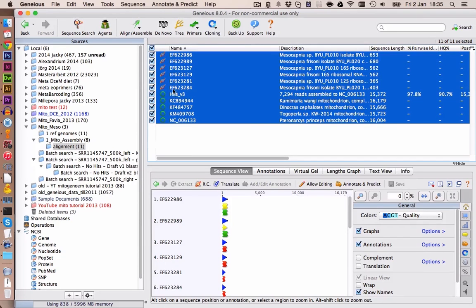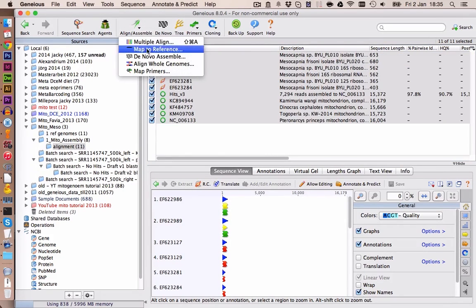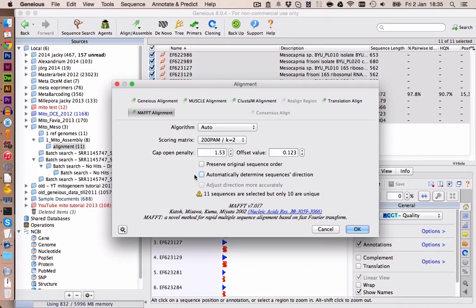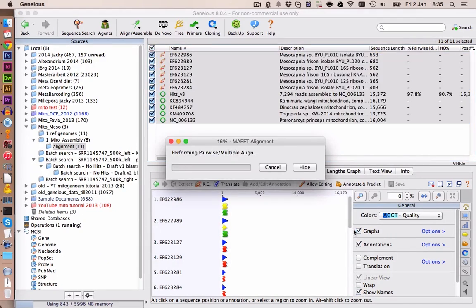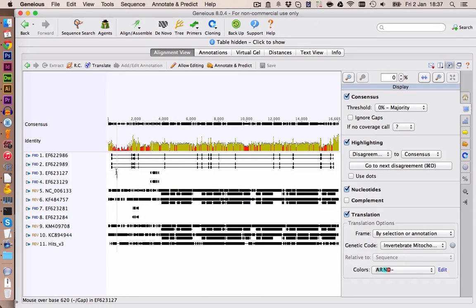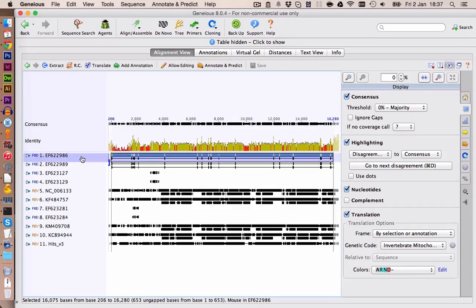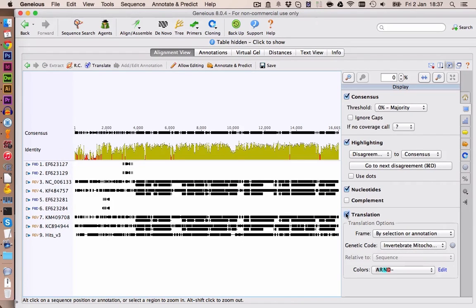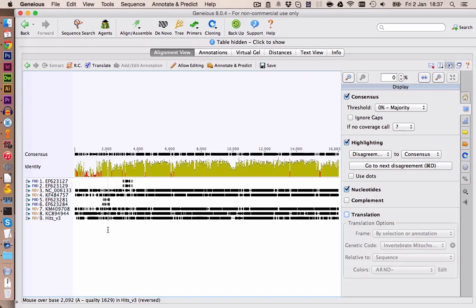Let's select all reads. And we're going to go on multiple align. We can try to let it detect the sequence direction automatically. Let's see if that works. Otherwise, we have to form the reverse complement. Let's take a look at the alignment. We see here 2 sequences didn't really work out, so we can delete those. And then let's zoom in here.